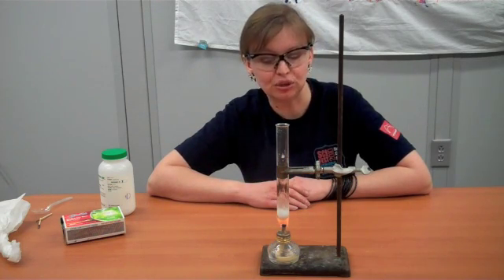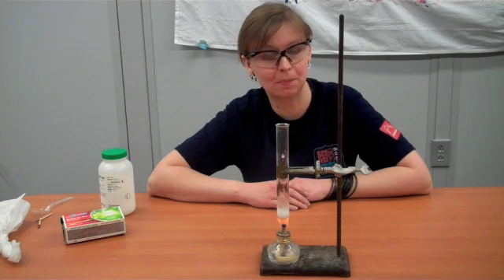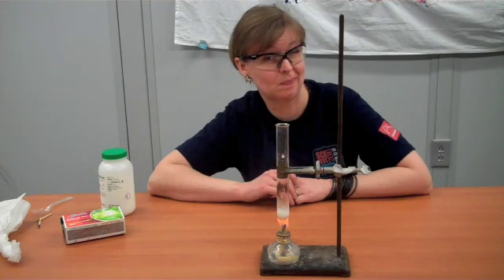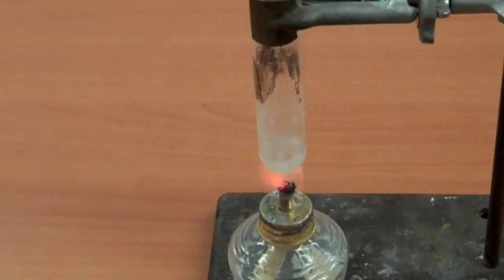So what we're going to do is a very surprising rapid oxidation experiment. Okay, so what I have in my test tube actually is some sodium chlorate.